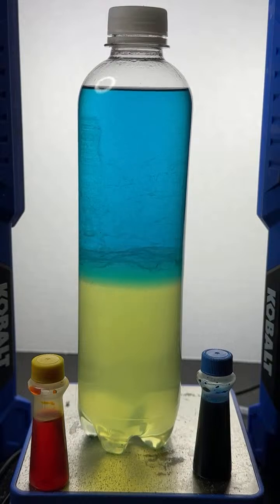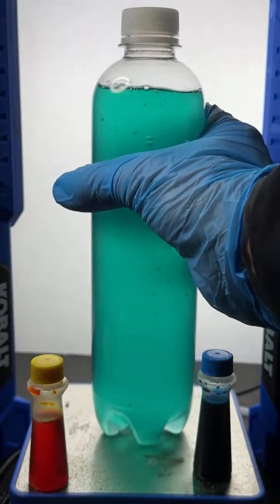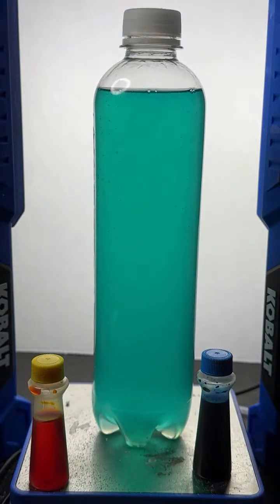Then what we do to that mixture is we add some of the salt. Let me shake it up again. When you add the salt, the salt dissolves into ions, and those ions absolutely love the water. And the water loves the salt, and because of that, they attract each other very strongly.